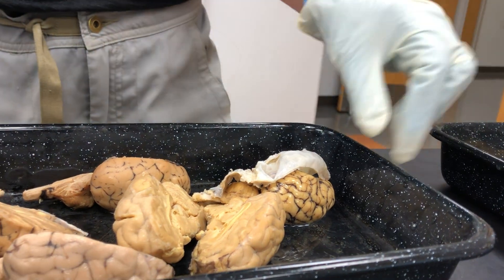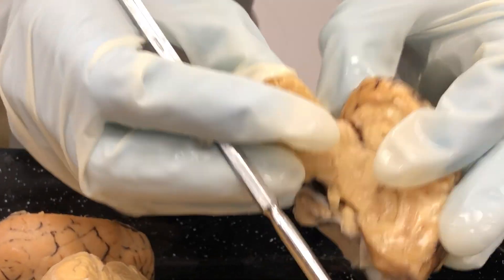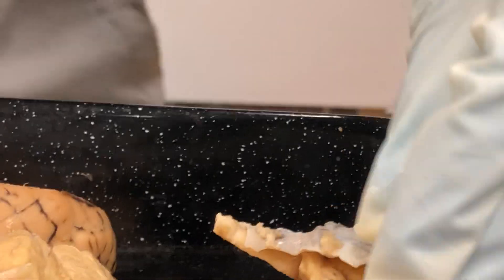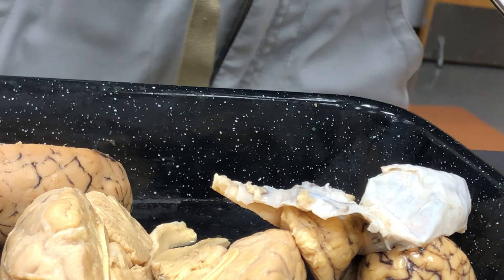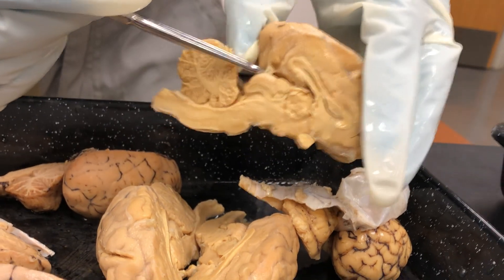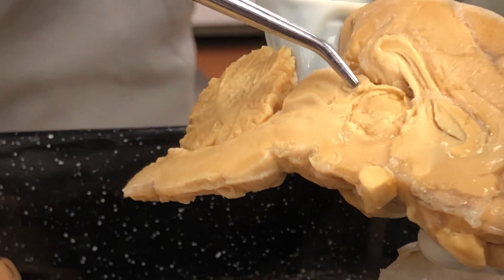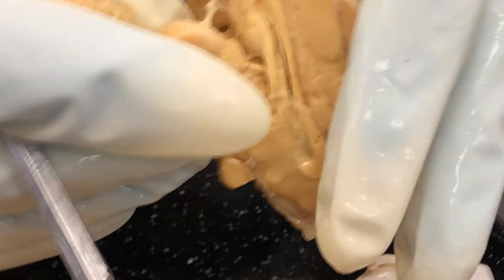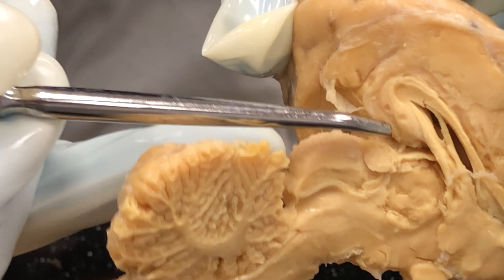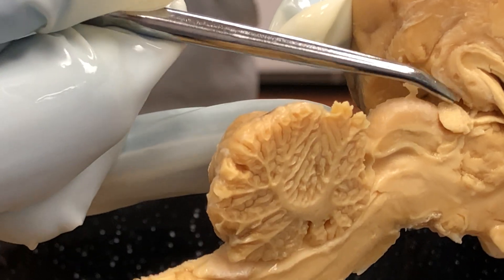The next structure we're going to find is the pineal gland. If you open up the back of the brain and move the cerebellum away from the cerebrum, separating along the transverse cerebral fissure, you will find a little structure. In this case you can see it right here. It's actually a little bit easier to see in the sagittal view, and in some cases you can see it from the rear view sticking up above the surrounding structure. So this is the pineal gland right here.